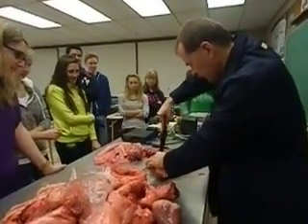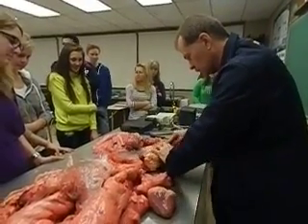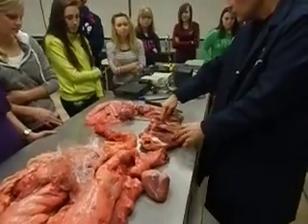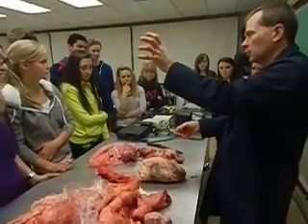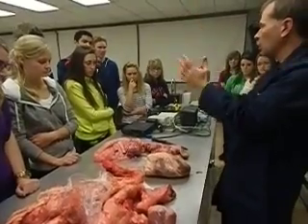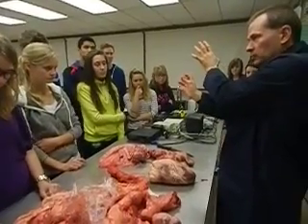Okay, the very tops of the chambers as we start going through the human heart — they're called atrium or atria; we have two of those. Then we have two chambers down below called ventricles. The atria pump their blood into the ventricles, and between the atria and the ventricles there are valves. Occasionally you hear of someone who has to have valve surgery on their heart because their valves are defective.